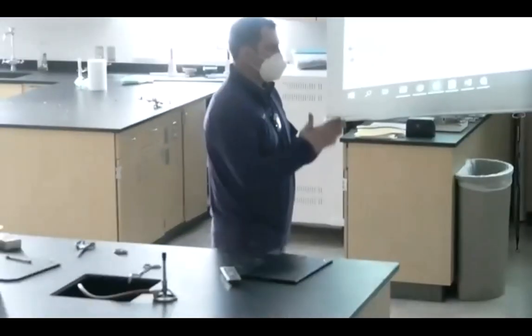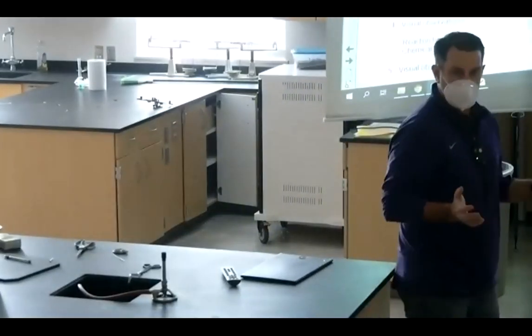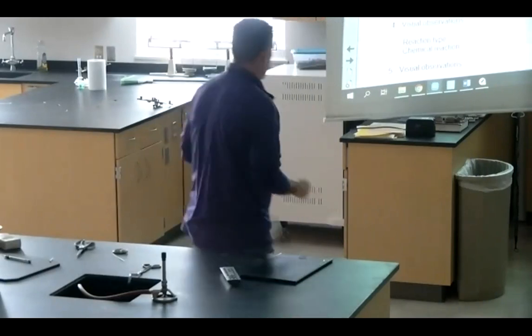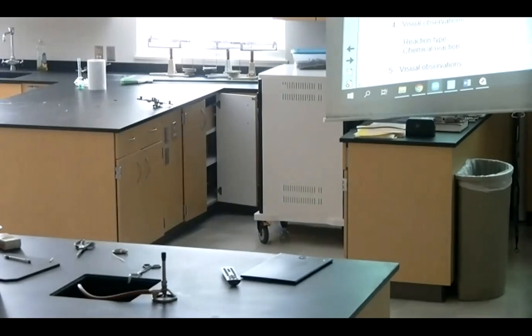All right, so that is that. Go ahead and write that down. One got a little bit stuck, as you probably heard me tell it to go down. All right, so write your observation. Could you guys hear it very well? Okay, we'll talk about that here in just a second. My hands are so gross, I'm gonna wash them. They're just hyper dry.